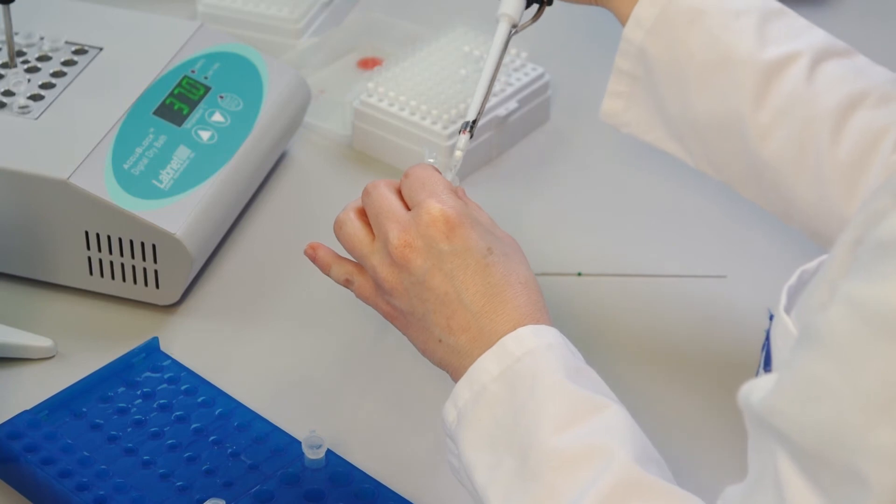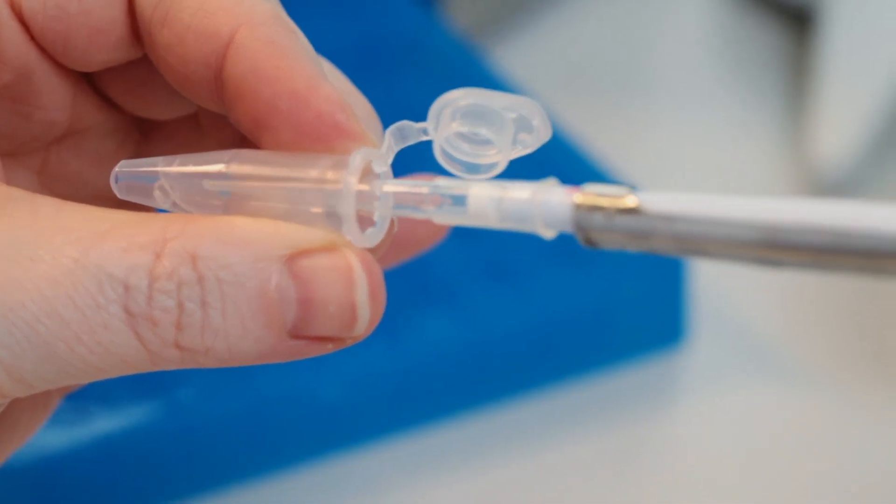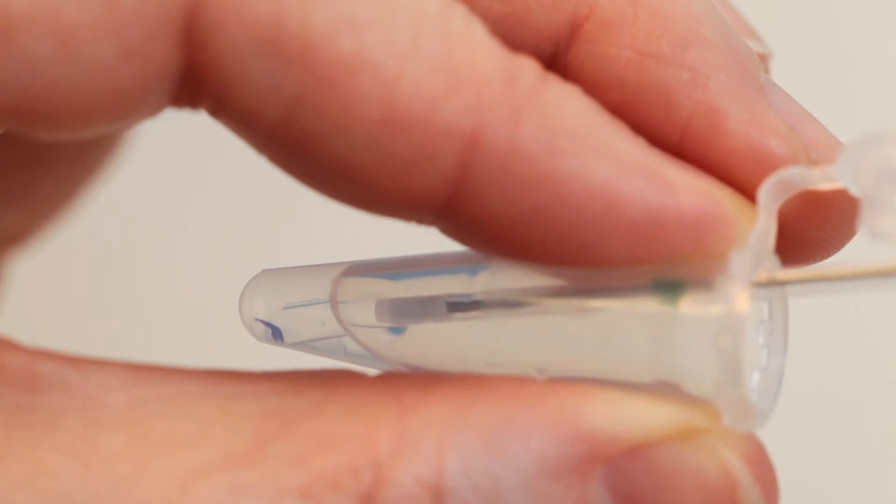Cover your sample with liquid agarose as shown with this stained, three-day-old Zebrafish embryo, and gently draw it into the container.